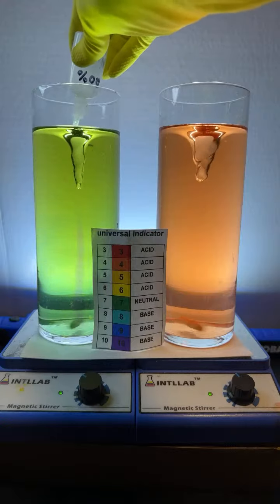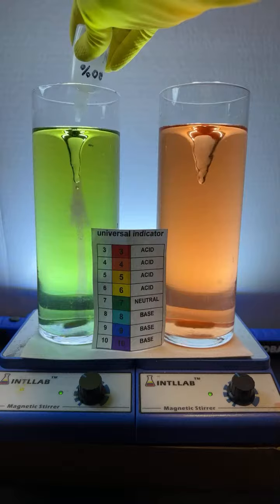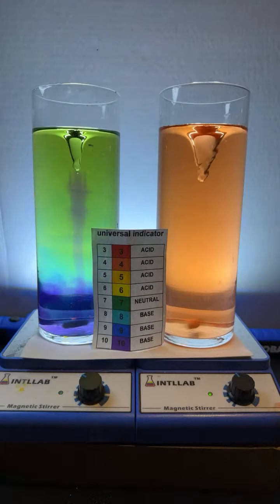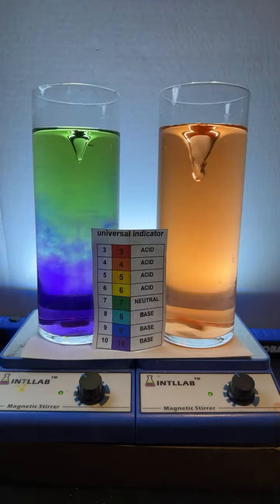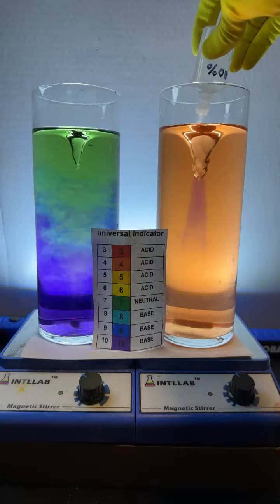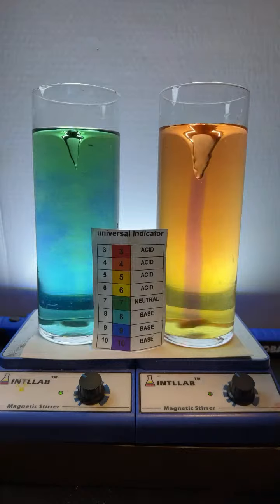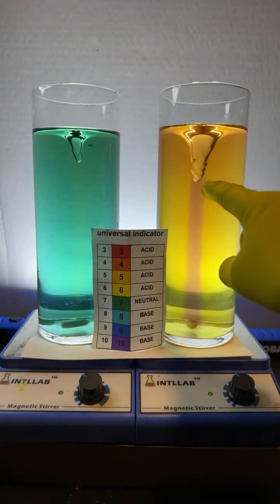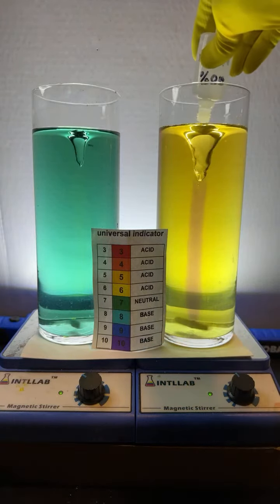Here we go. So I want you to notice, you see that blue color that's added? That's changing the pH to basic. You might notice that the material stays focused in the center. See if we get it over here too. You see that? I'm over here on the right now. As I'm adding the sodium hydroxide base, you see that blue color. It kind of stays there in the middle. And you might ask, well, why does it do that?